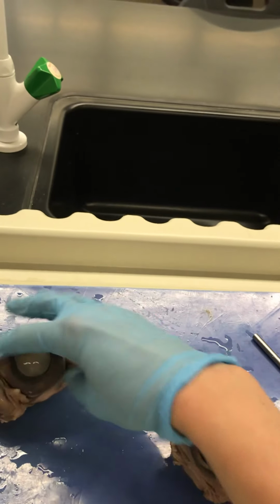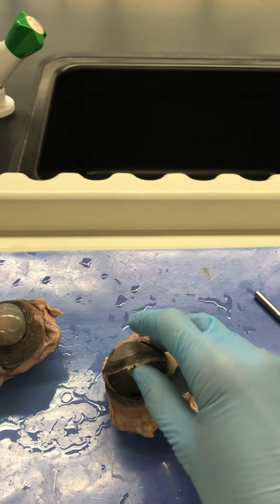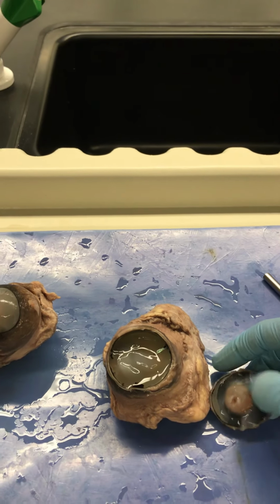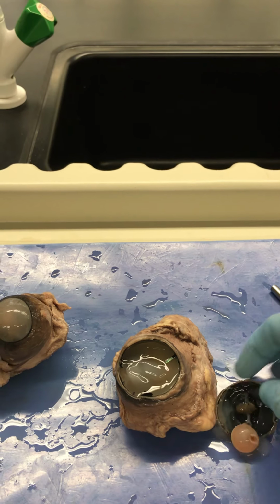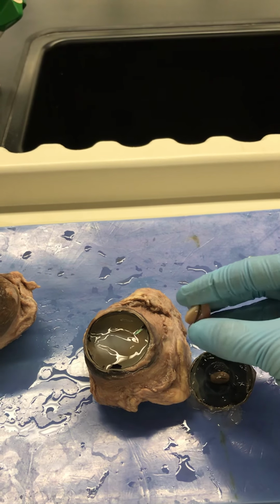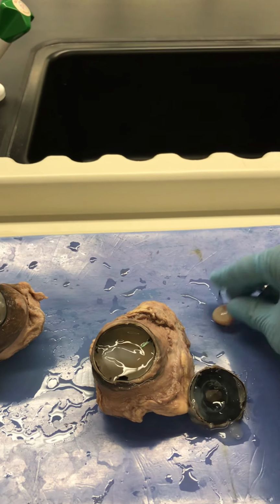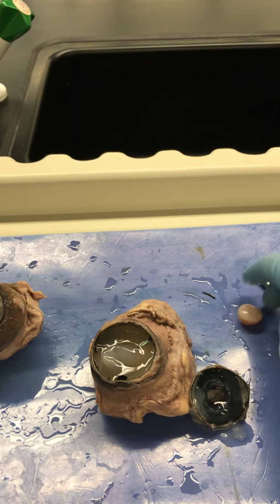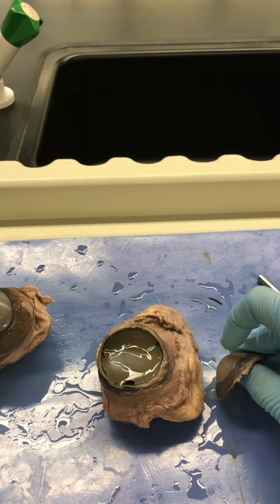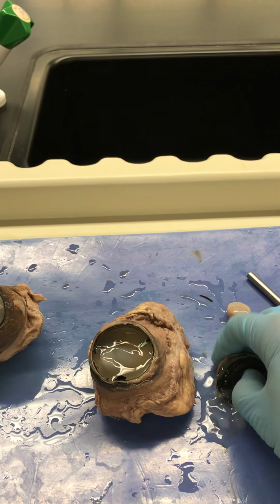So let's take a look at the internal aspect of the eye here. So I cut it. Let's see if I can open it up here. All right, so this is the lens here. I'm doing this one-handed, but you can pop the lens out. And generally the lens, or normally the lens, would be clear unless you have cataracts, or in this case, you've been soaking in preservative for a while. It looks like a little marble here, and it is going to refract light as it comes in from the cornea. It'll hit that lens and bend it. I'm grossing you guys out now with this eye jelly, I'm sure.